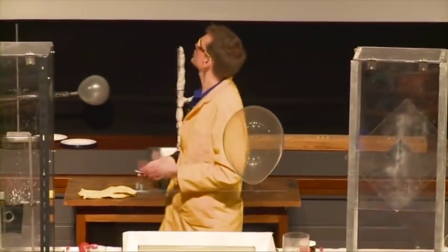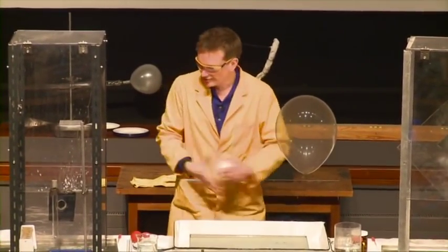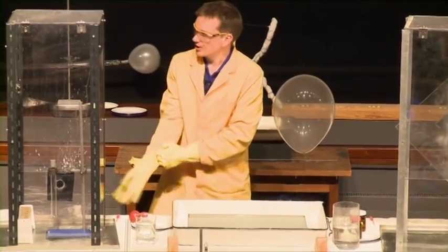So this is a chemical reaction now, where sodium here combines with hydrogen. Well, I can show you the properties of sodium hydride. We have some in a tube here. Sodium hydride is a fine powder. Very, very reactive.